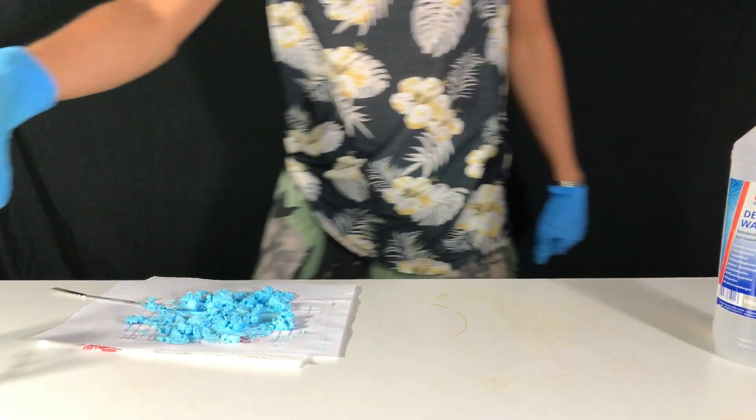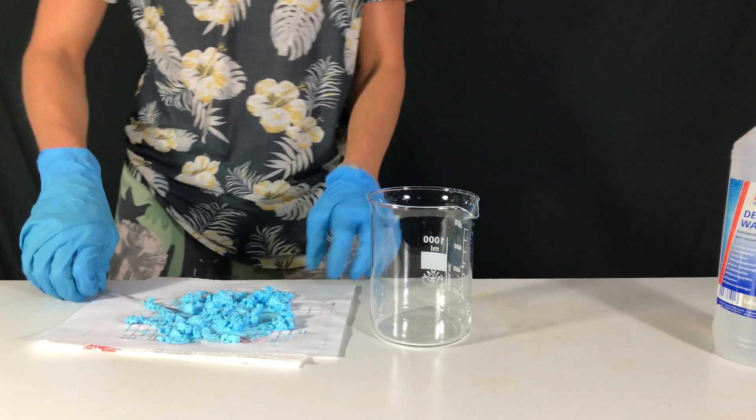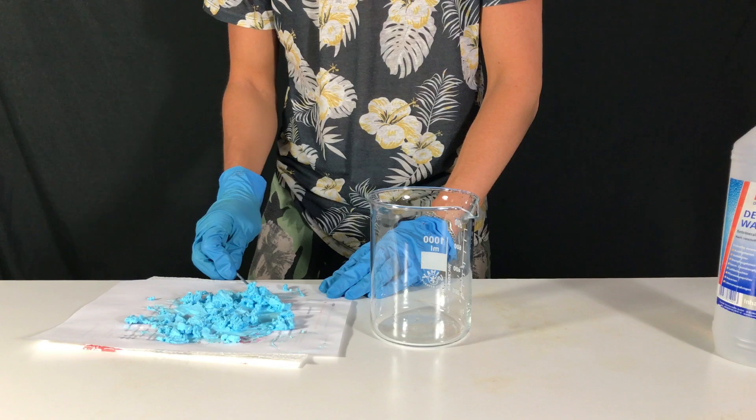Have a look at our crude product. I have to say that this product looks really interesting for a copper salt. I wanted to purify this product even further and therefore I transferred all of it to a clean new beaker.